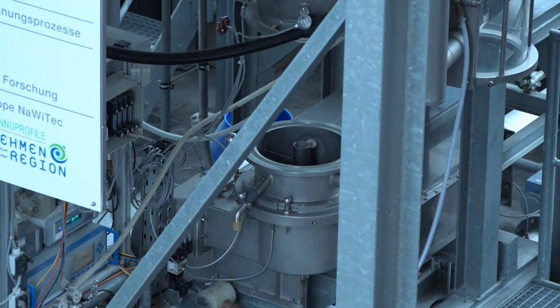Let's stop once more. So here we can see the process chamber, and later during the process the chamber is closed by moving the glass part back to this position. And what we can see here is a classifying tube, so we are able to take out particles continuously from the process, and we can see the temperature sensor which is recording the bed temperature. Then we also have a sample taker, so we can take samples over this tube.